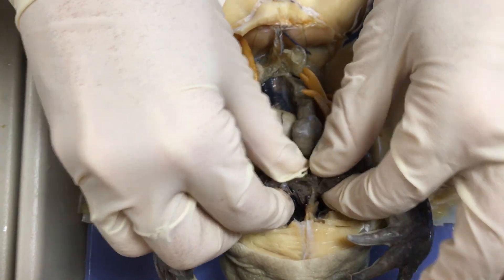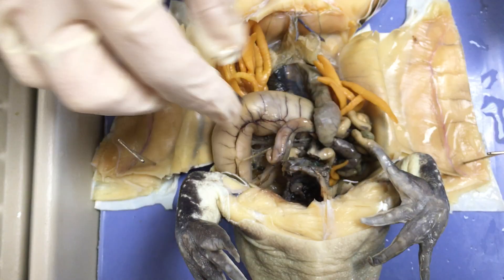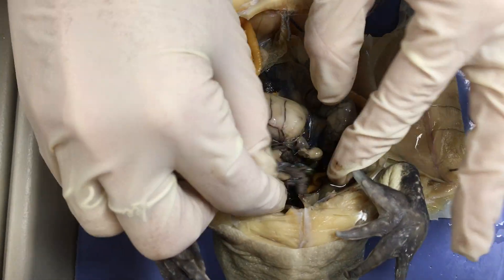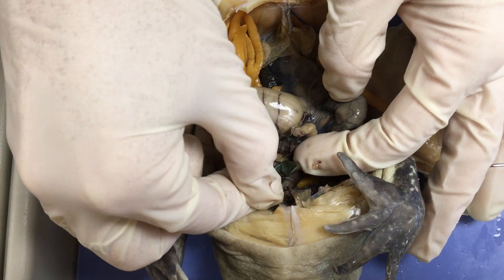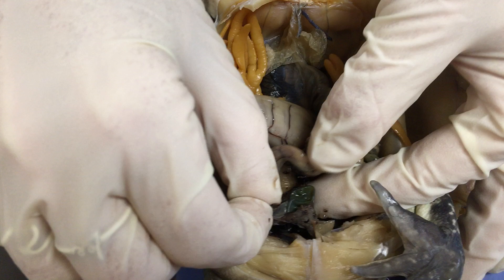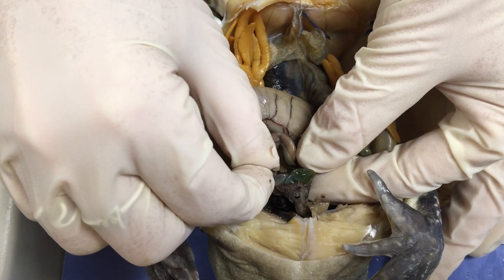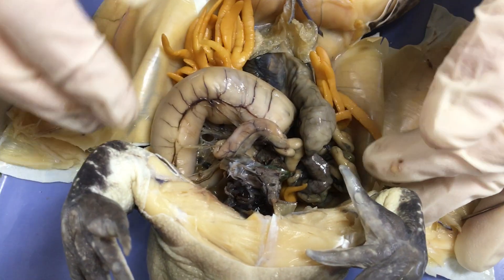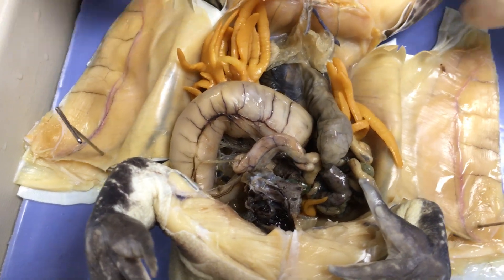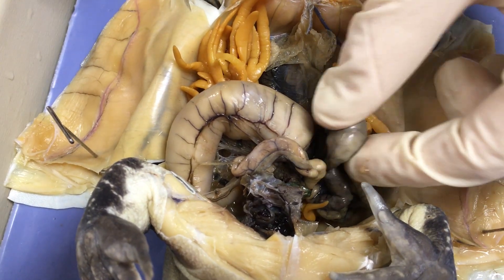Now that we've got those out of the way, the next structure that sometimes comes out when you take the liver out is this little green ball here. It's deflated now, but this is the gallbladder inside of the frog. It's used to store the bile that the liver is producing, and then sends it into the digestive system to help with digestion.